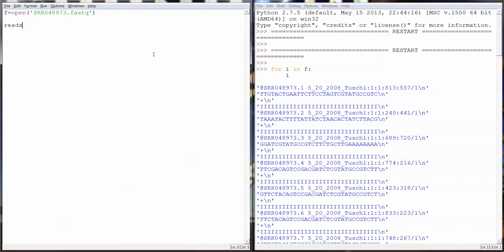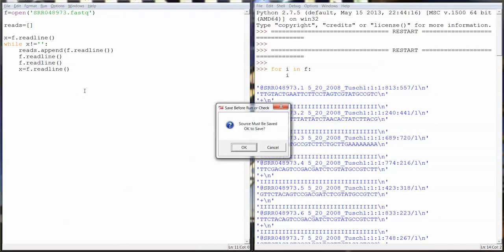So let's say we want to parse this file and only get the read sequence, which is what we're interested in. So we're going to make an empty list, reads equals empty list. We're going to start with x equals f.readline. Then we're going to do an infinite loop, basically, until x equals an empty string. So basically until the file is finished. So then we're going to append the very next line. So we started with x equaling this, then the very next line is the read that we're interested in, and that's what just got appended. Then we're going to do two f.readlines, and then we're going to set x to equal f.readline one more time. And that's going to just read this entire file. So we start with x equaling this, then we appended this, then we read two lines, and then we set x equal to this again, and that's just going to go on and on and on.